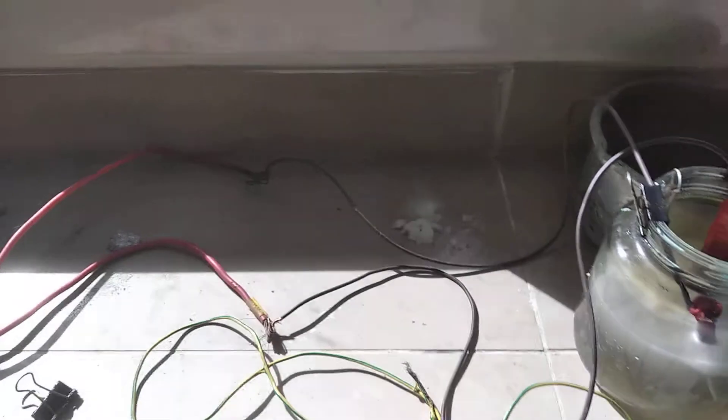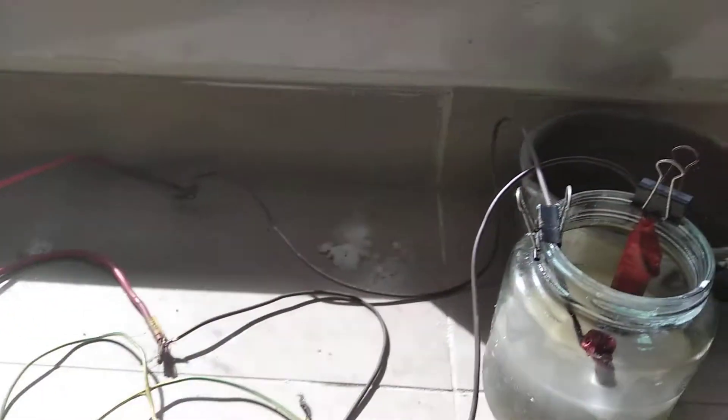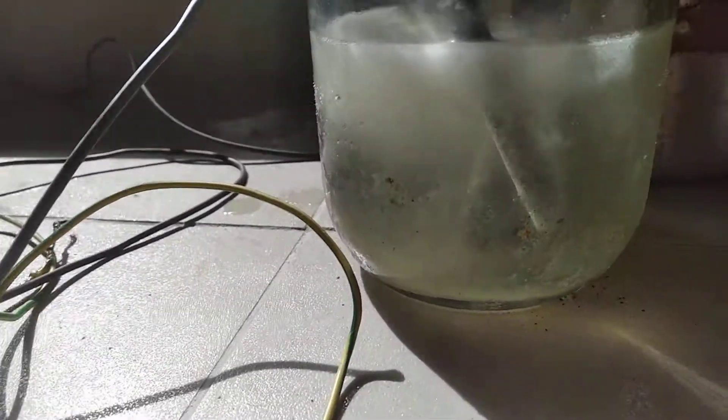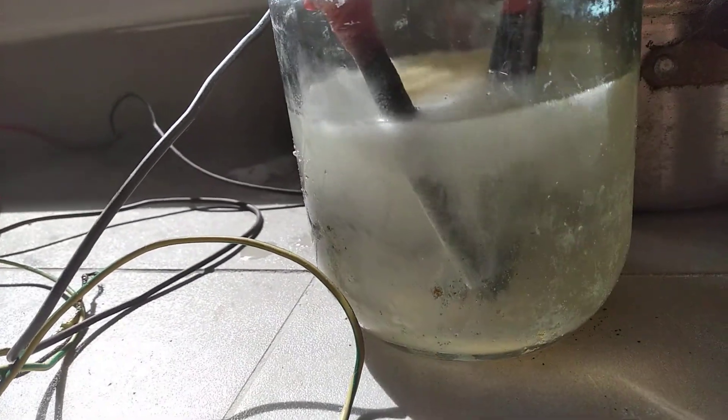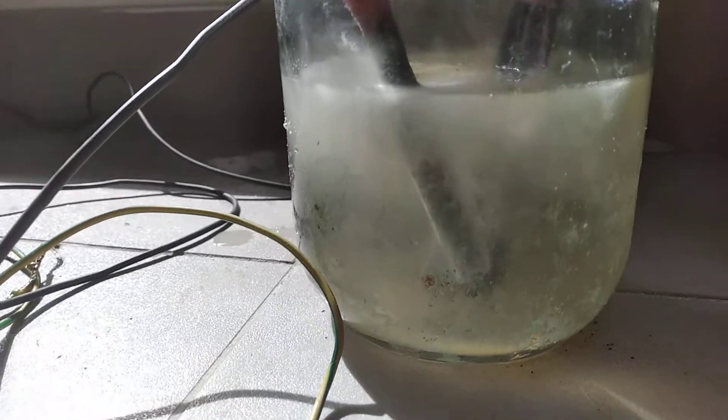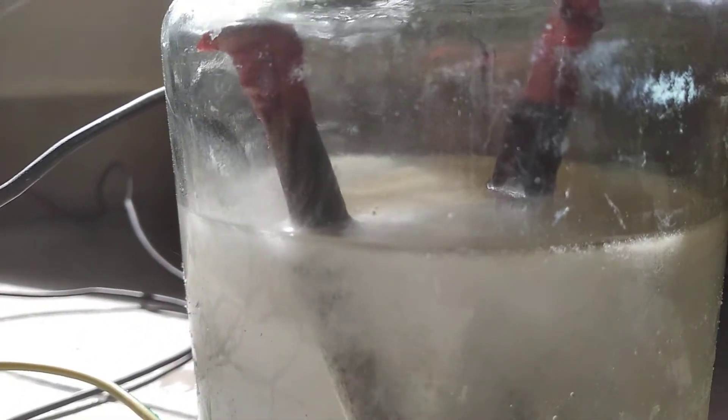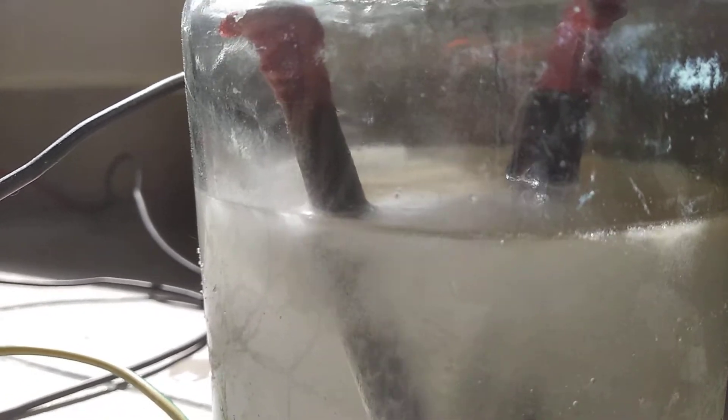Anyway, let's just say that I have to divide that number by 2.5 to 1. So here we have this solution that's been running for approximately two hours now in a saturated solution of sodium chloride and a little additive to control the pH, which is calcium chloride.